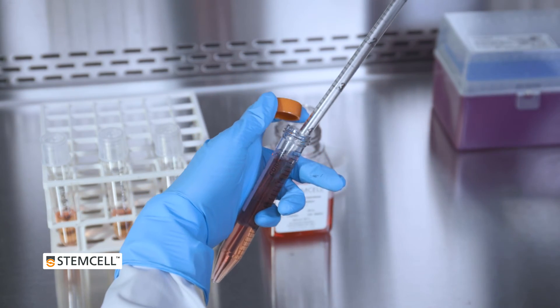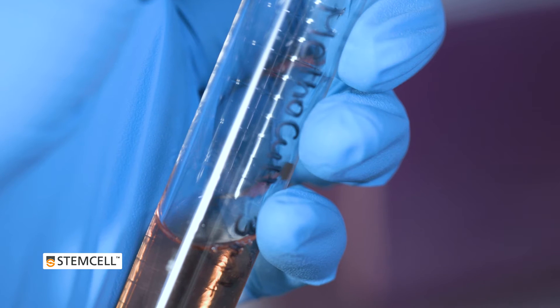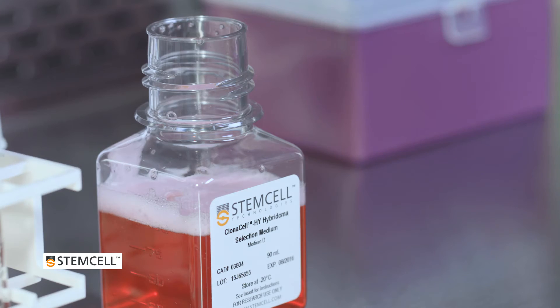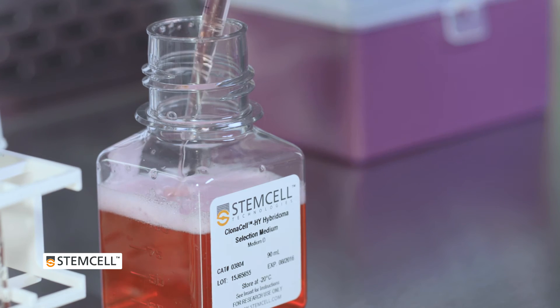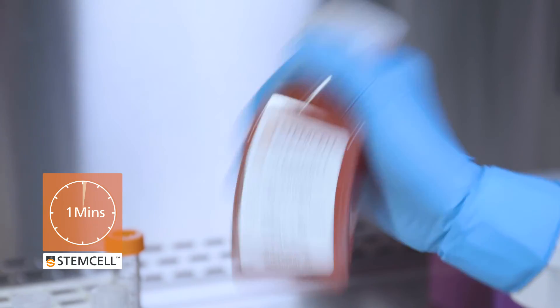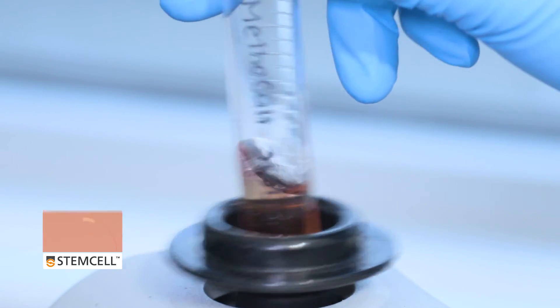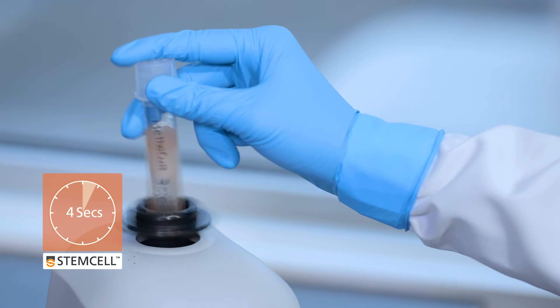Add the appropriate volume of concentrated single-cell suspension. Mix by shaking vigorously for at least a minute. For smaller aliquots, mix by vortexing for about four seconds.